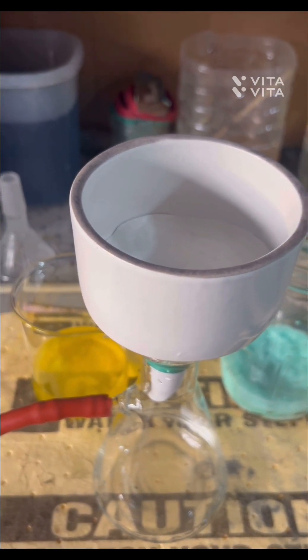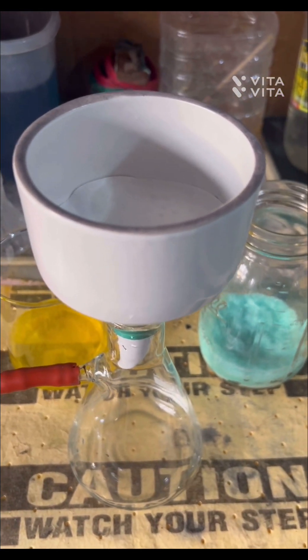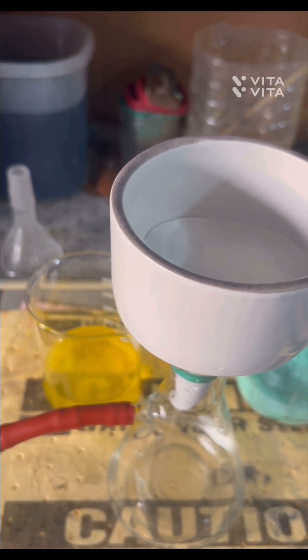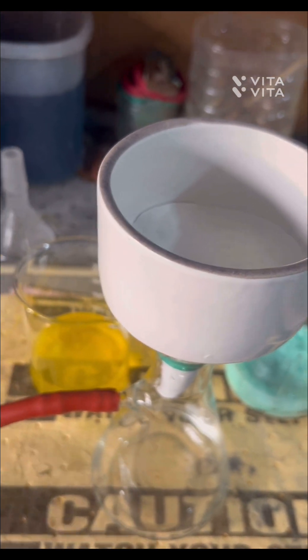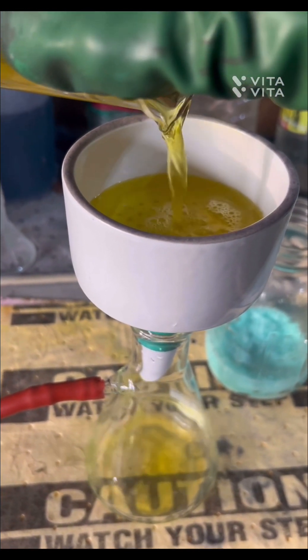Welcome back. We're going to go after this gold — here's the iron sulfate right here, took a couple of days to make. There's the gold we're going after. I'm going to filter that, dilute it, and then drop it with ferrous sulfate. So we're going to start off with filtering — got the vacuum filter going on in the background.